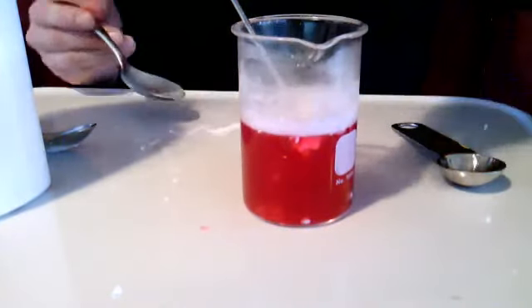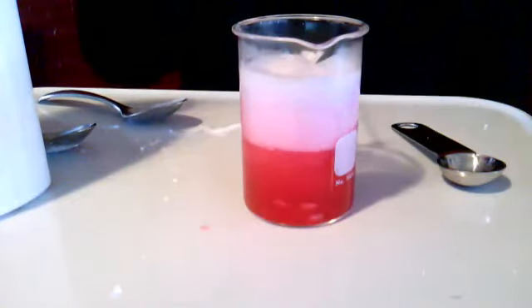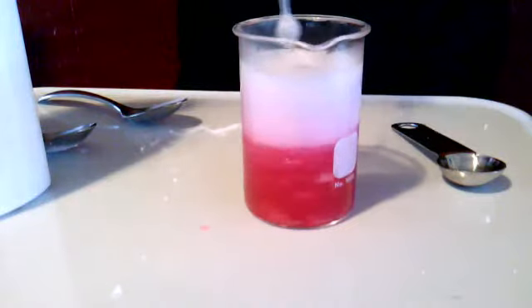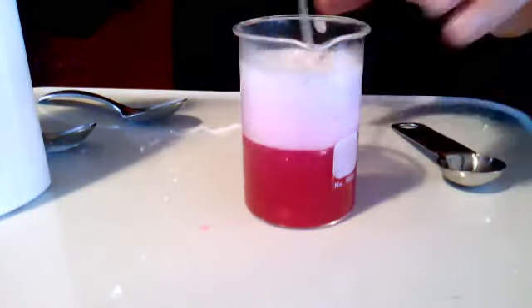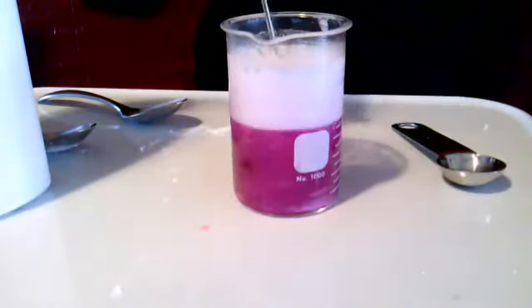Here we go. Our friend here is taking Tums number 2. Oh boy, we got all kinds of gas buildup. I hope it doesn't get gas all over my table. That's why we're using this white plastic. This is not the color of my table. Okay, they're finally feeling a little better.